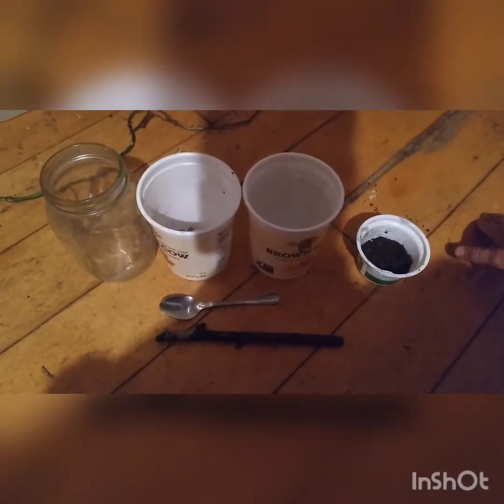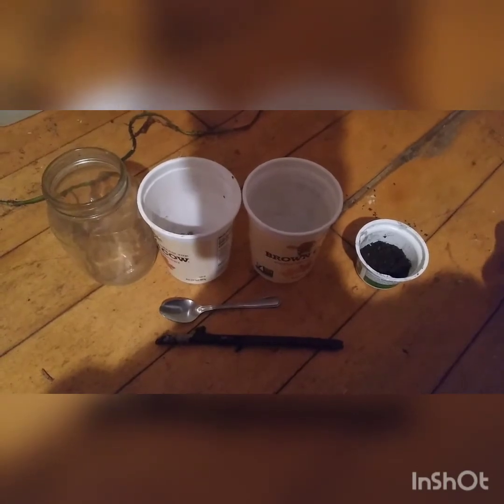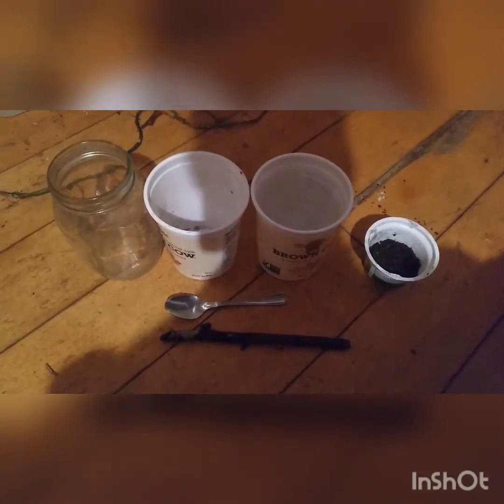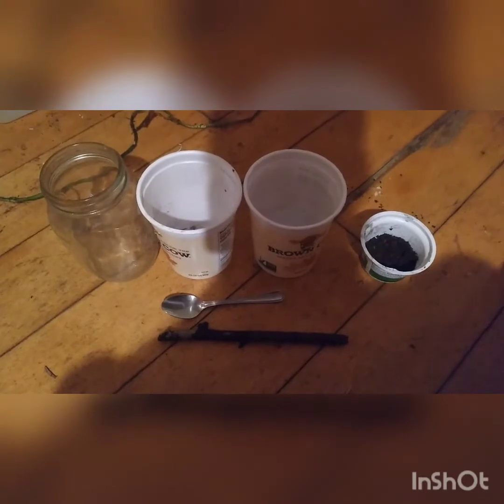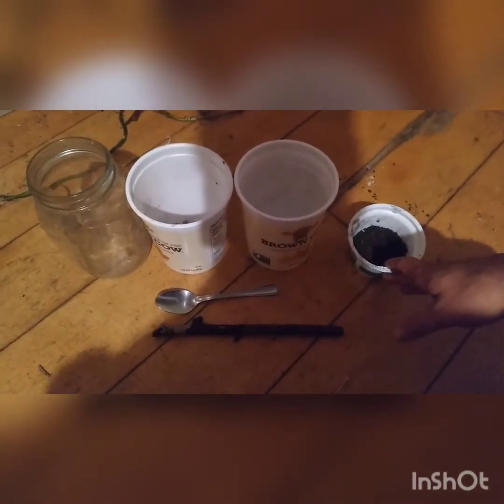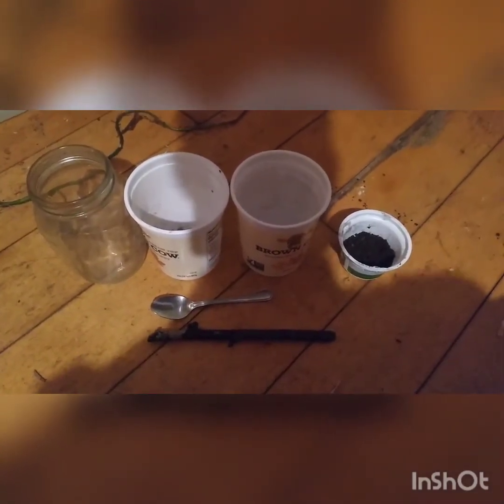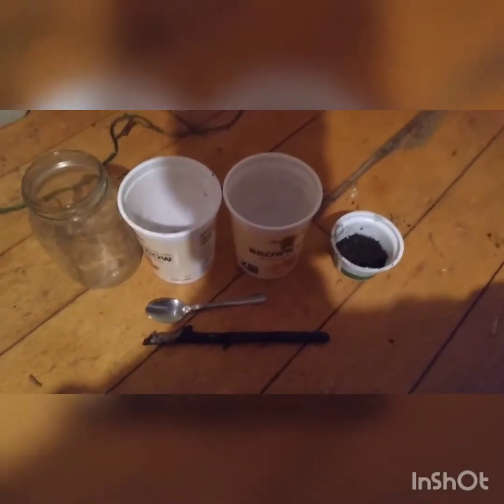But you can also separate the spores out, which makes it a little easier to use because it's more concentrated, and it's better if you ever want to experiment with the effects, because you know exactly what you're adding in — rather than just soil, which can have a lot of other microorganisms. Also, you can see it through a microscope this way, because it's separated and will end up in a solution of mostly just water.